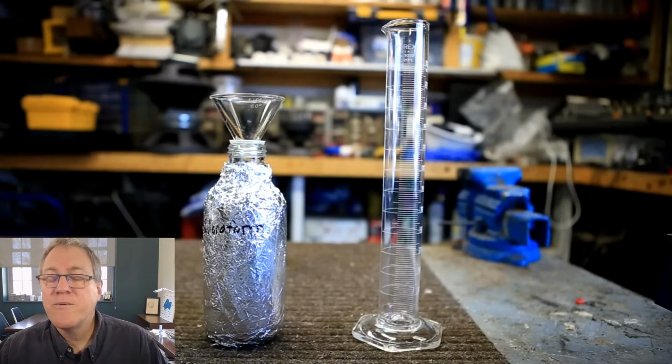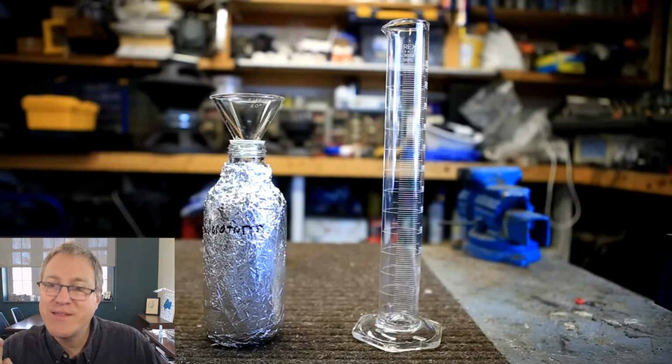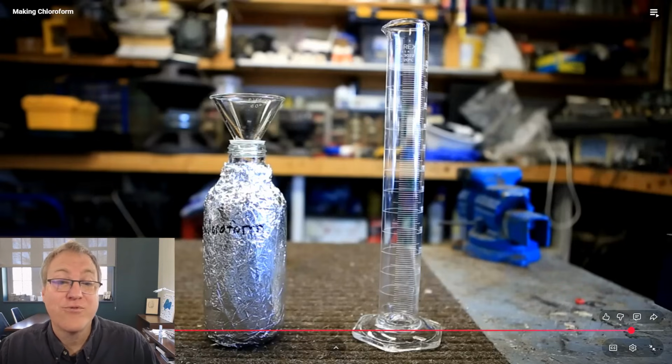Now that bottle is the type of bottle you see in lab all the time. Notice how it has that plastic lip on top of those threads. That's an old bottle that was used for like 500 milliliters of a strong acid. They tend to be strong bottles. They're great bottles for storage.